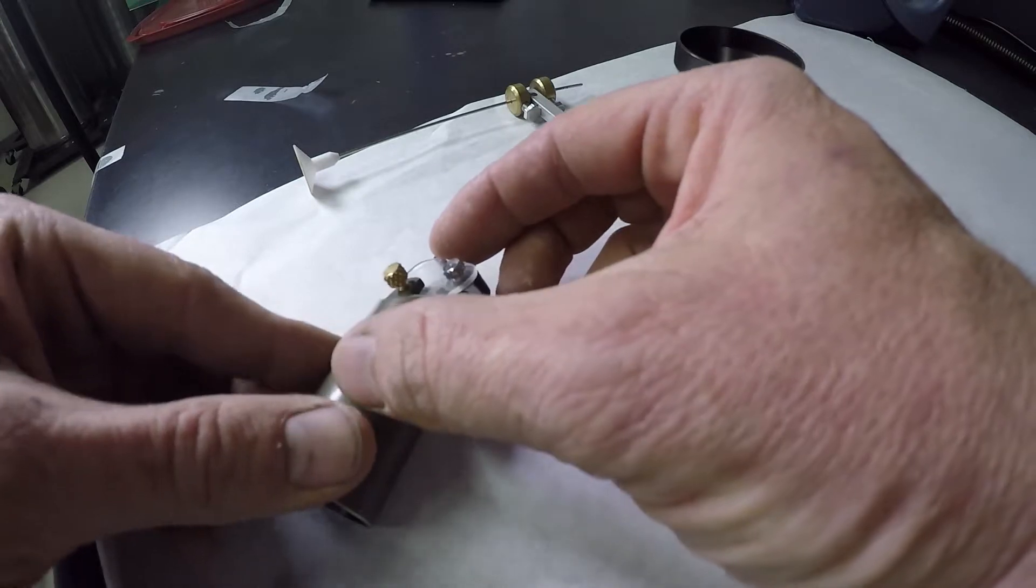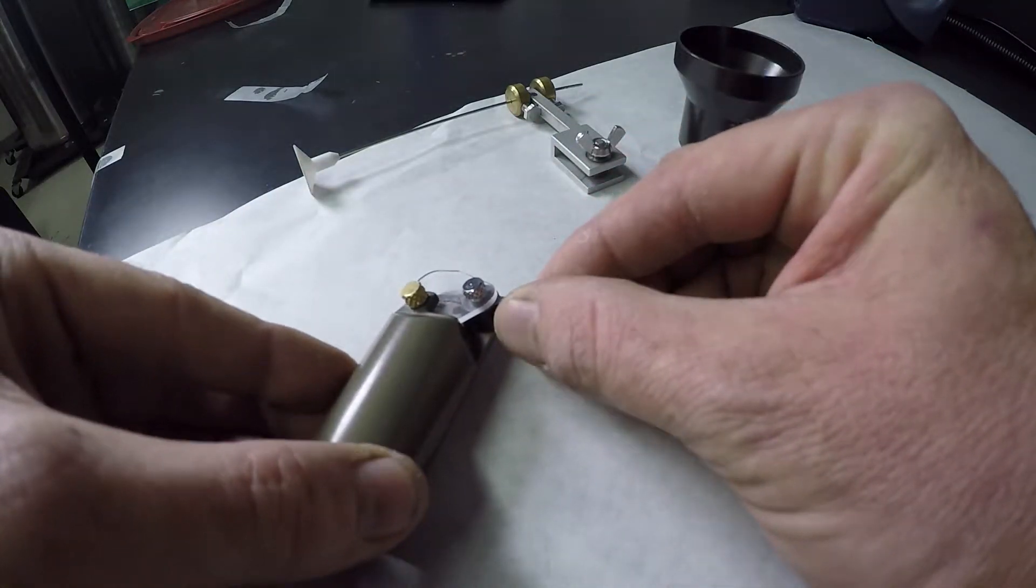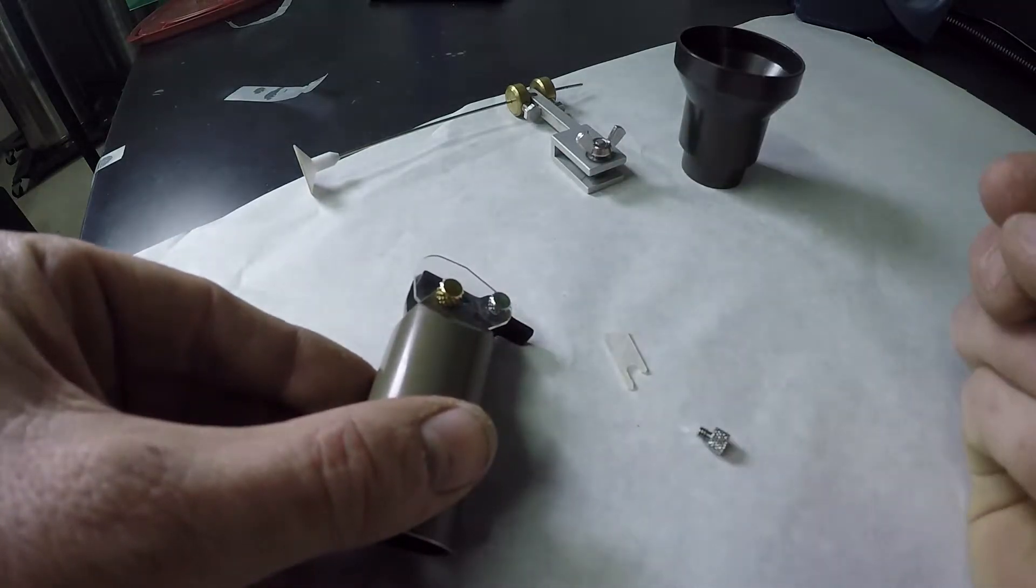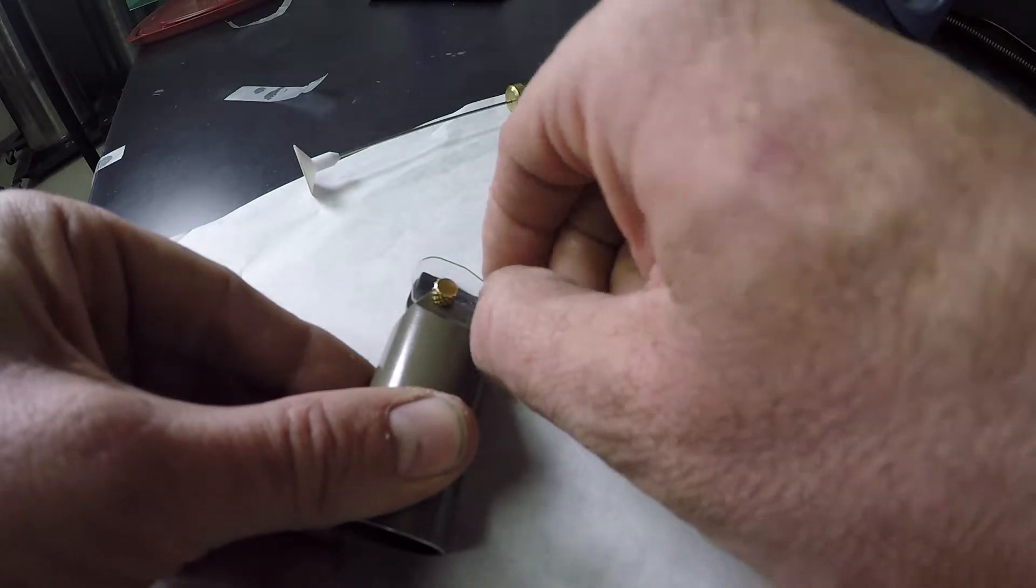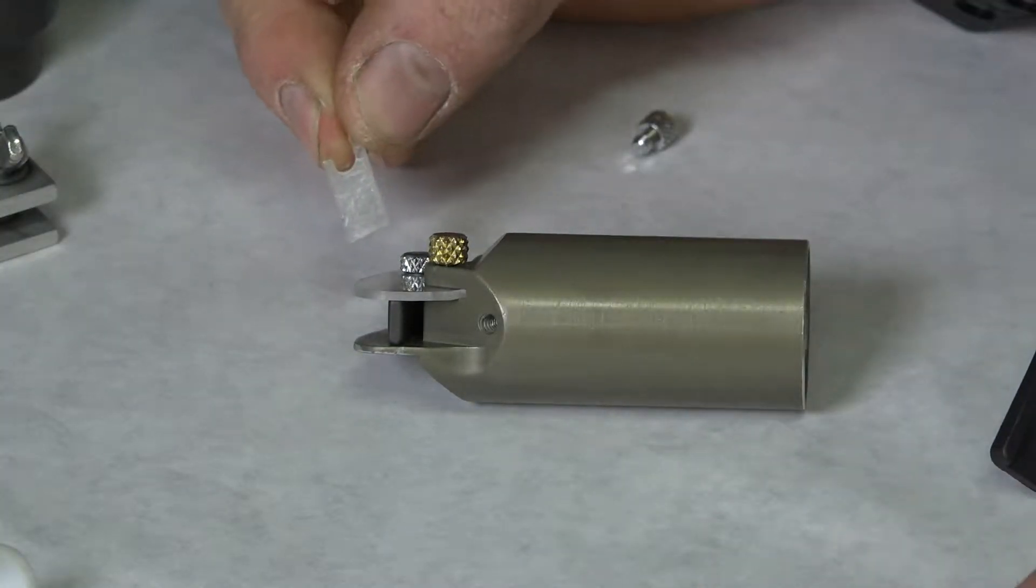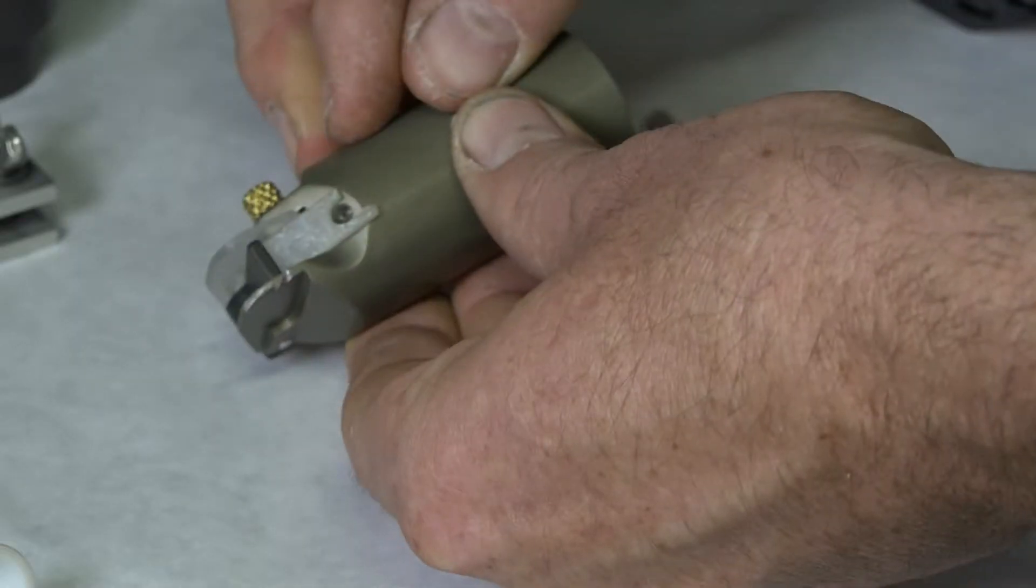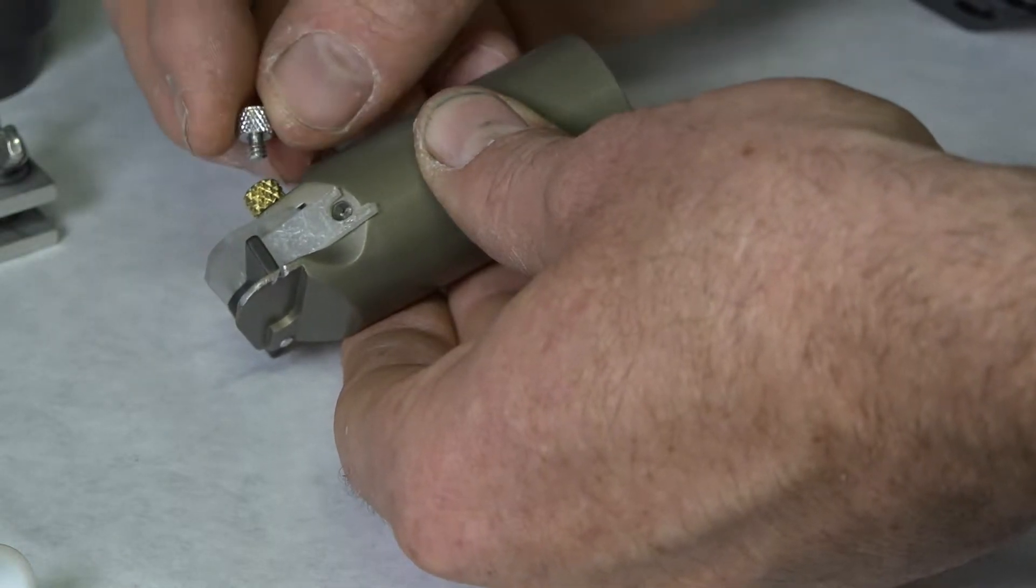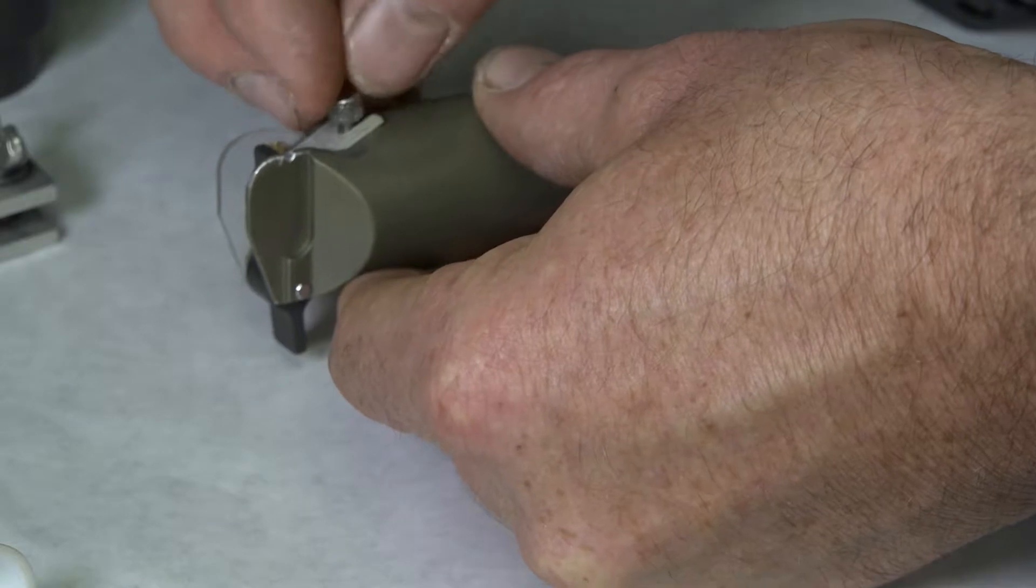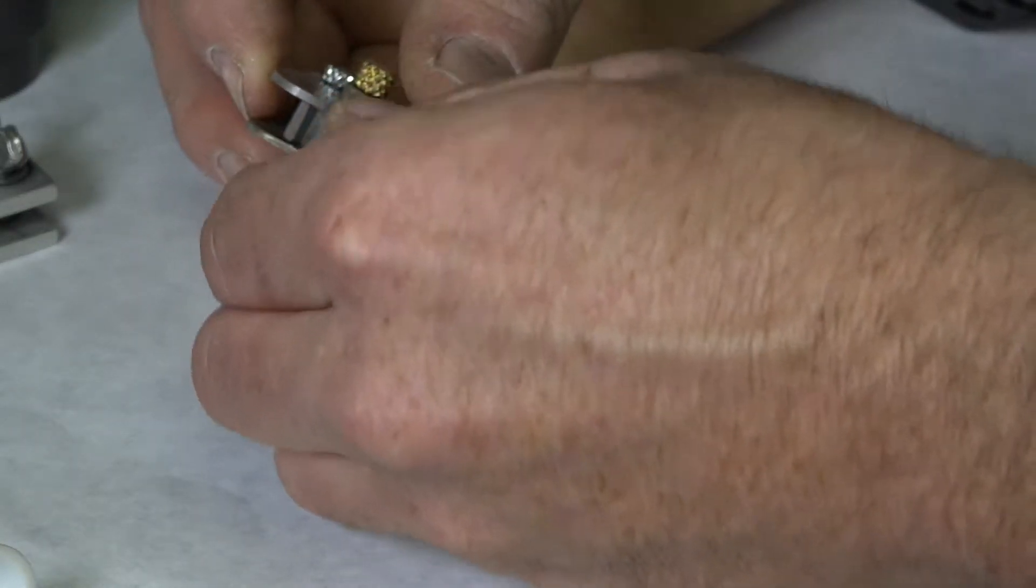Once it's still loose, you push the plastic shield into place and tighten that side set screw. What I like to do for this ramp is swing it all the way closed, and then you're just swinging it open a little bit. In the front you want to see like just an eighth of an inch. Tighten the back, that little hinge screw, as tight as you can get it. You also have this little blocker thing in the front that prevents too much sample from rushing out. So what you can do is put that into the front of this feed system.